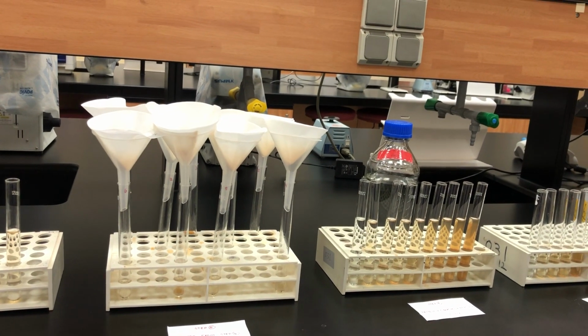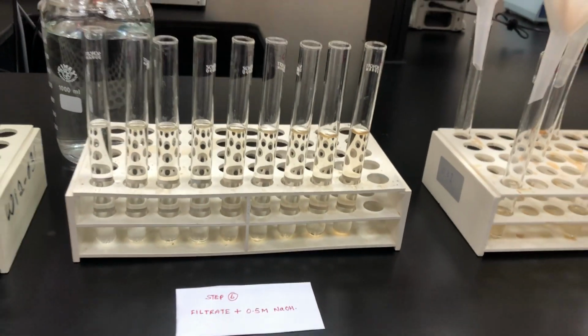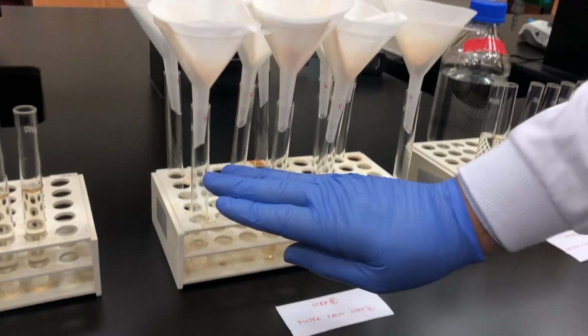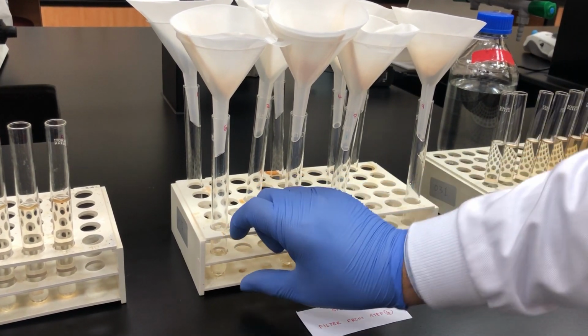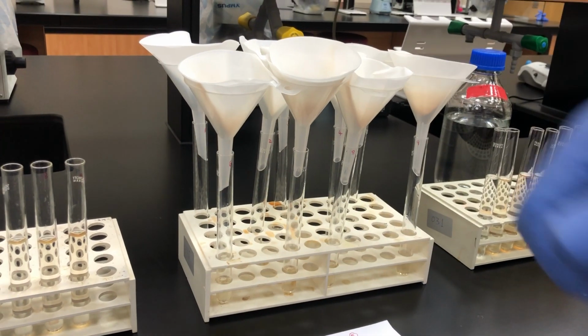After you finish the filtration, you will get the filtrate here. After you get the filtrate, you will take only 5 ml from it. Just 5 ml. We will put a marker for you. Here we have a marker, meaning up to the filtrate. Up to this marker means this is 5 ml. So when it reaches 5 ml, put it in the other rack.